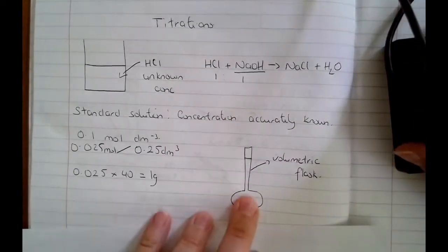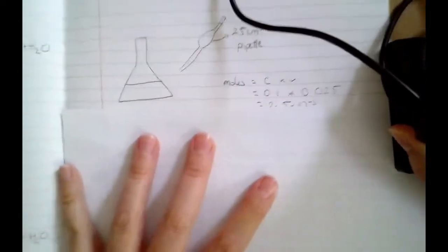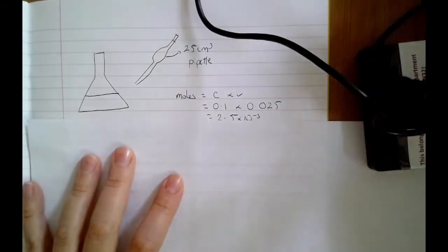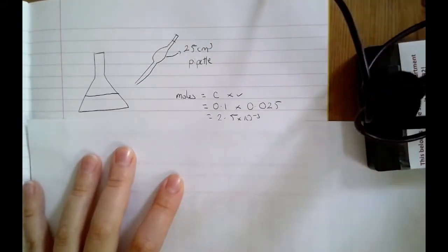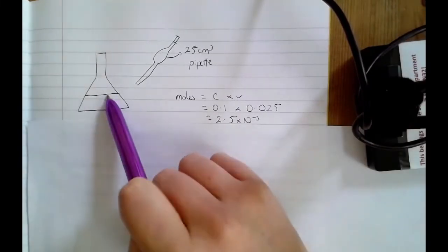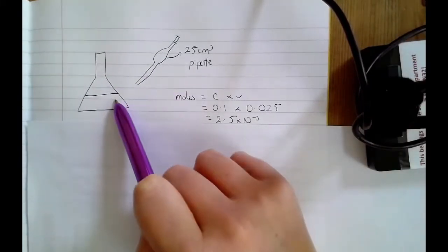And once you've got your standard solution of sodium hydroxide, you can actually do two things here. You can either add your standard solution to the burette, or you can add your standard solution to the conical flask. It doesn't actually matter which way around you do it. In this case, I'm going to say I'm adding my standard solution to the conical flask.